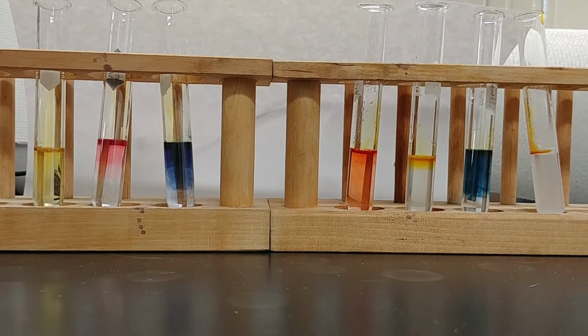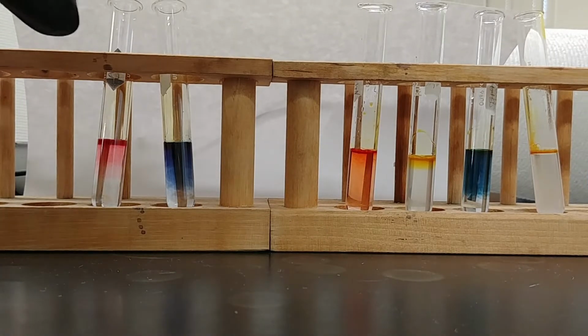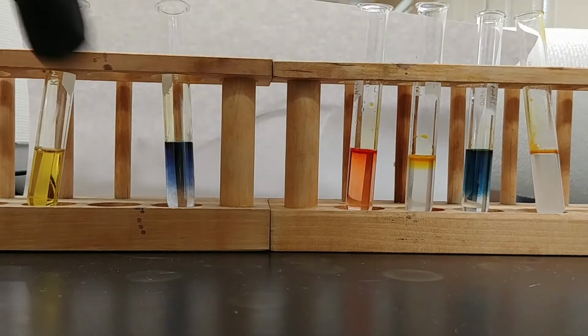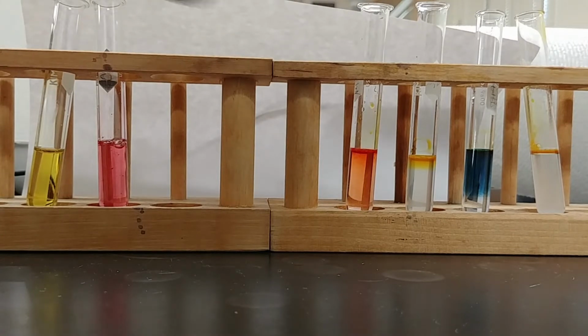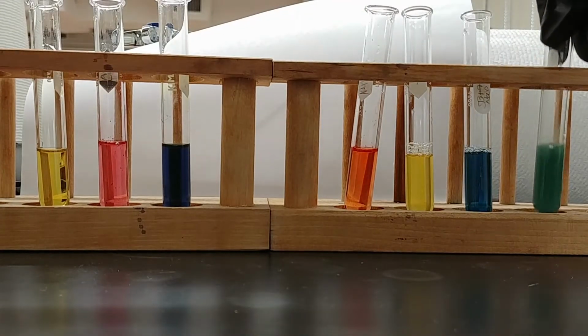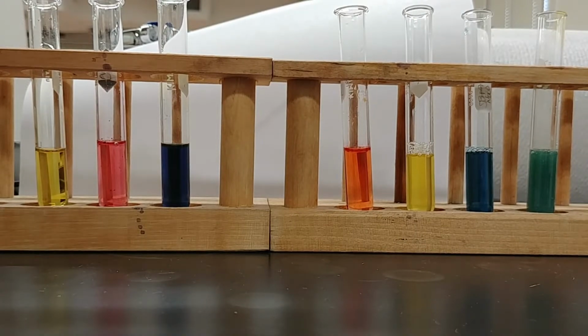What you're going to do is use this color to, again, kind of guess what the pH of these solutions are by comparing them to the pH range that we saw earlier. We're going to mix these nice and thoroughly so you can get a better idea of the colors. Once we've used the colors to take a stab at what these pHs are, we're going to use something called a pH meter to verify whether these are acidic or basic solutions.